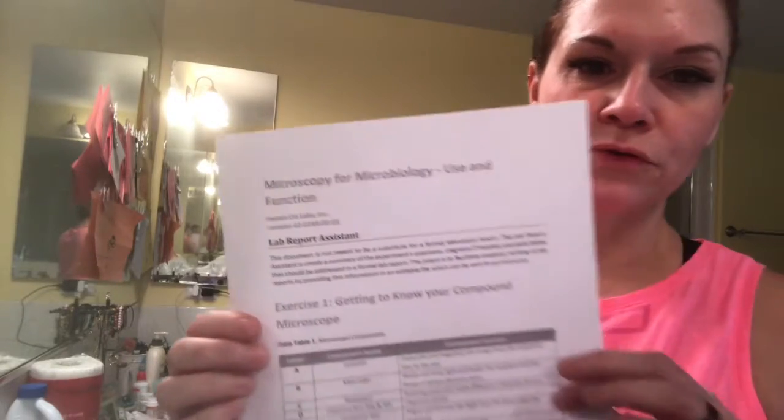Bio 225. It is May 25th, 2019. I am doing the lab for microscope use and function for microbiology. This is my lab report to give me ideas on what I did for the lab.